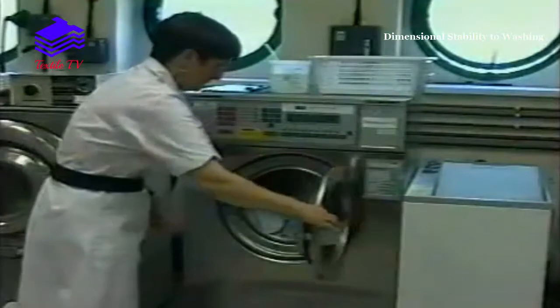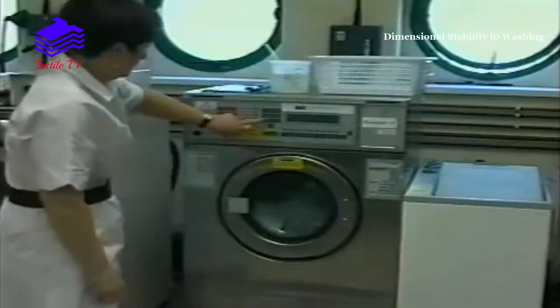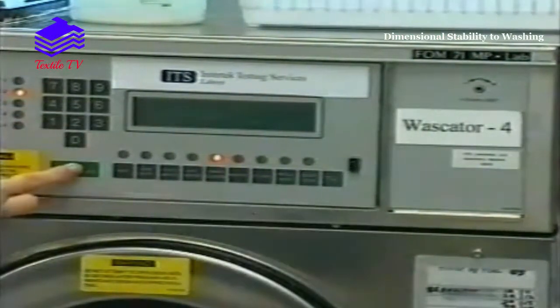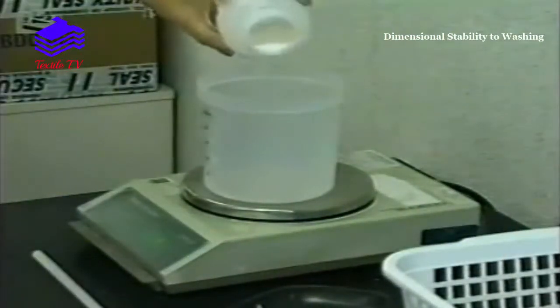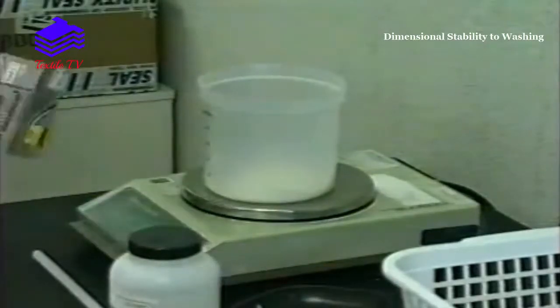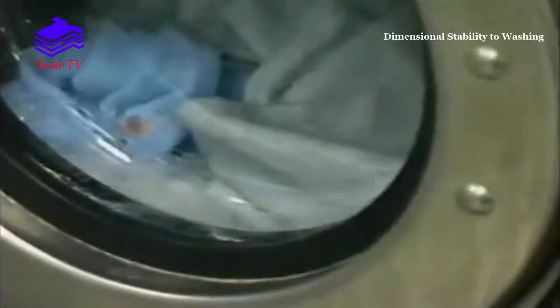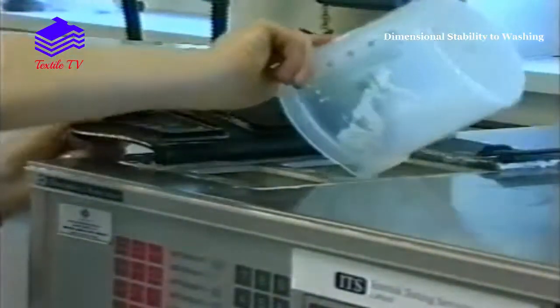The door is closed and the desired programme selected using the keypad, which provides the complete cycle through wash, rinse and extraction. The detergent solution is prepared as appropriate. The start button is selected and, as the machine fills with water, the detergent solution is poured in through the detergent dispenser.